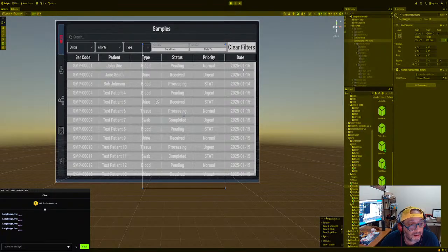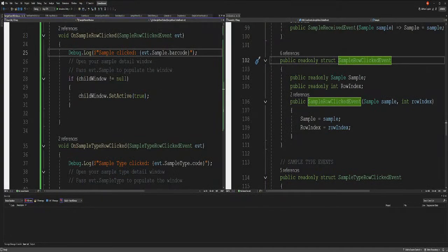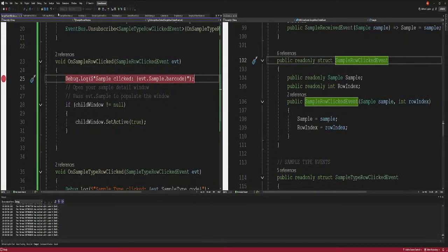So here, right? And so when we click on this, this should open. Okay, something went wrong. What went wrong? Simple. On row click event, set the row to active. Let's give that a try again. Let me see what's dead. It says something. Oh, okay. All right. Let's close that out. Start again.